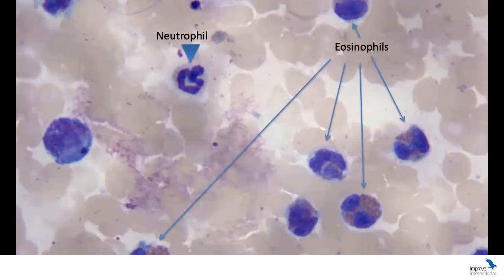But when we have inflammation, you have to look for the cause for inflammation. So obviously, if we have neutrophils, we go and look for bacteria, but we can have many other causes for neutrophilic inflammation, just necrosis, immune-mediated disease. So lots and lots of causes. If we have macrophages, we're going to look again for organisms, usually more complex organisms such as protozoal or fungi, or mycobacteria, foreign bodies.